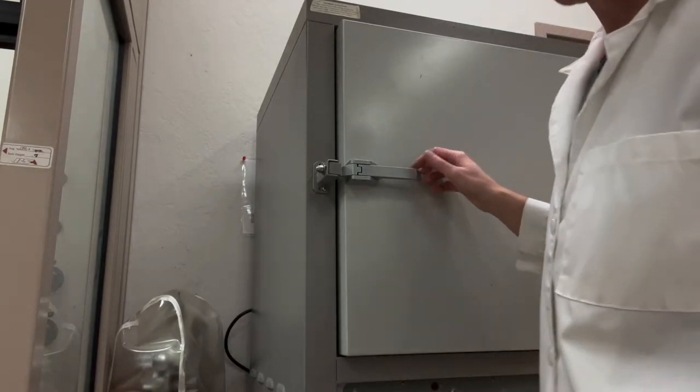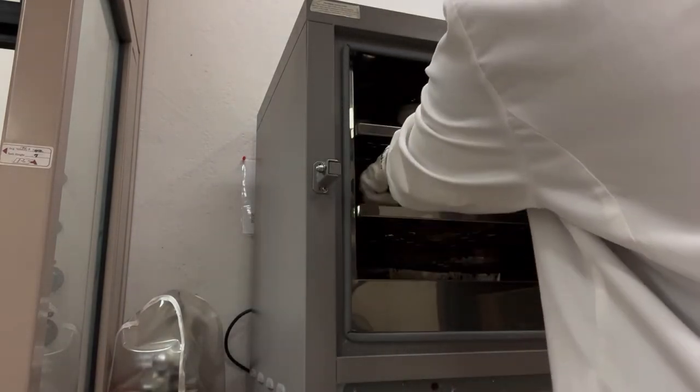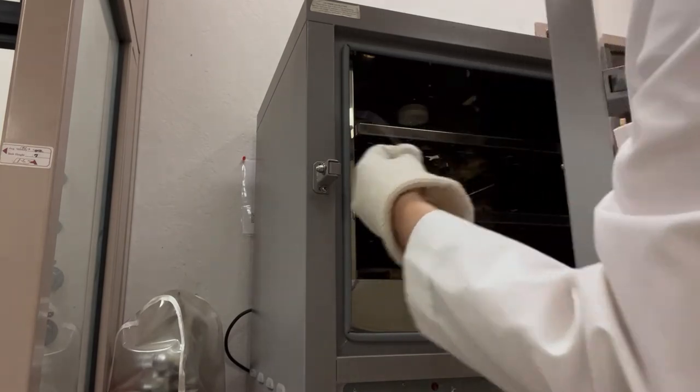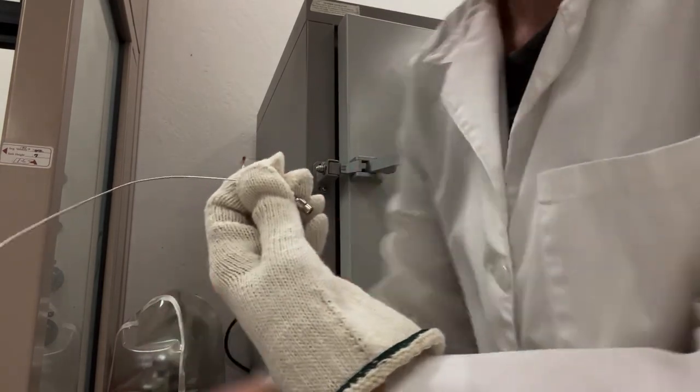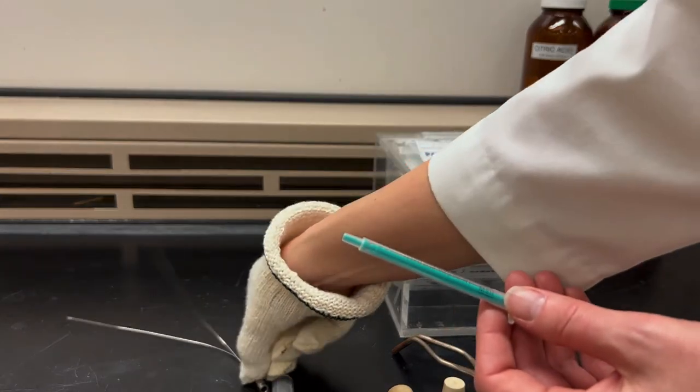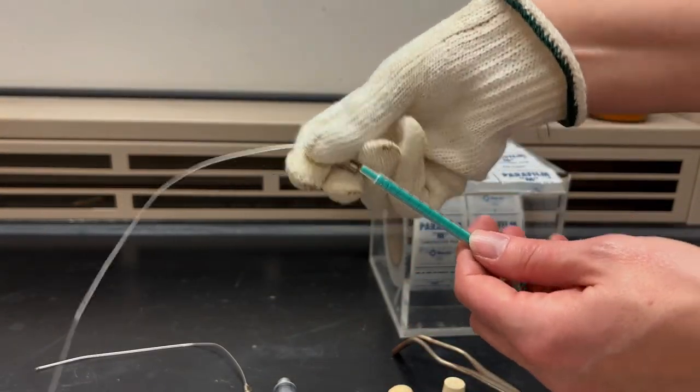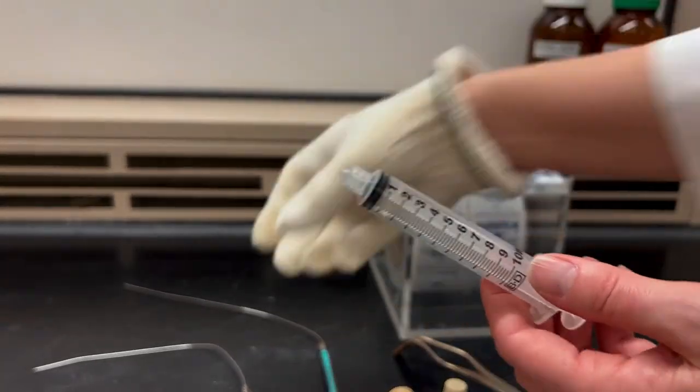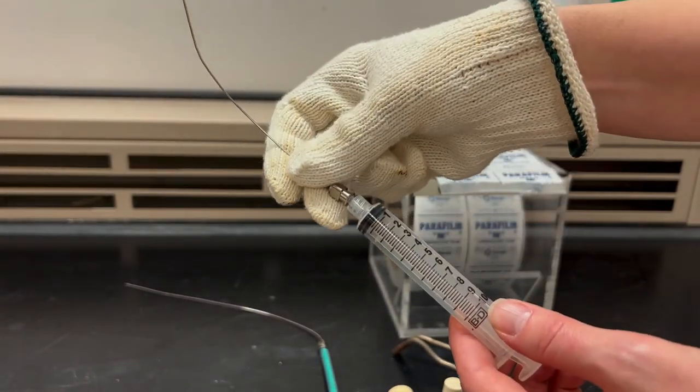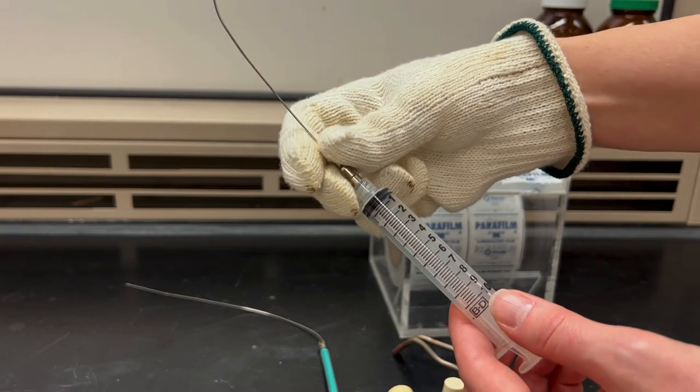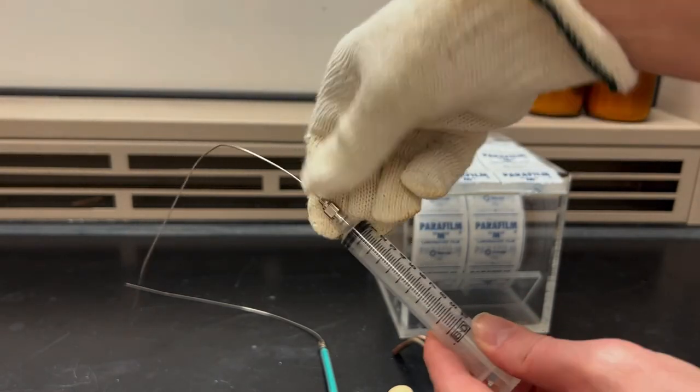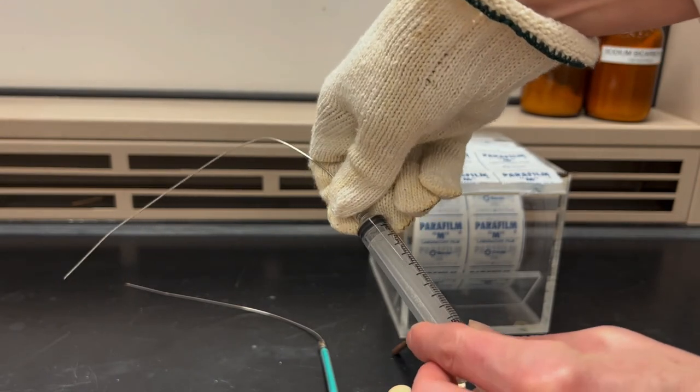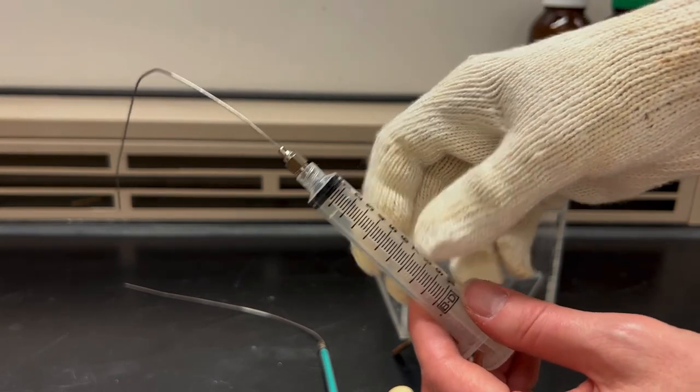Next I'm going to prepare my syringes. If we're trying to exclude water then you'll want to have previously put your metal needles into a hot oven. So when it's time then you'll just use your gloves and grab one of these needles. If I use a small one milliliter plastic syringe I can just attach the needle through friction. I basically just squeeze it on there. But the larger syringes like this one, these are called a luer lock syringe and those actually screw on. So what I would do is position it where I can see the numbers. And then I would take the metal needle where it's first curved upwards and then I screw it so that I go roughly a half turn. And by doing that I now can still see the numbers while the needle is now pointed downwards.